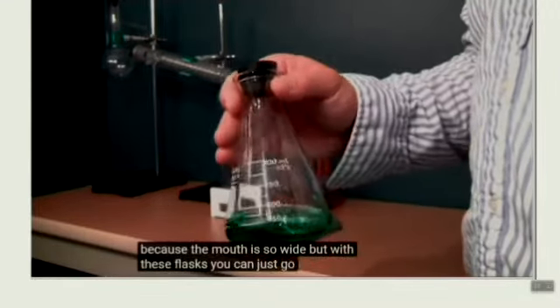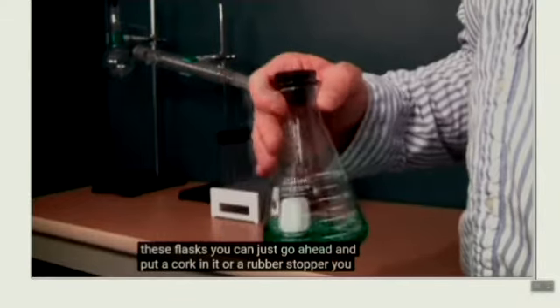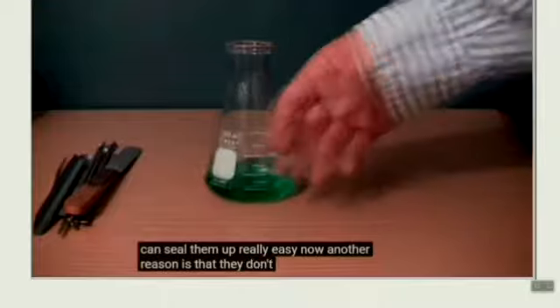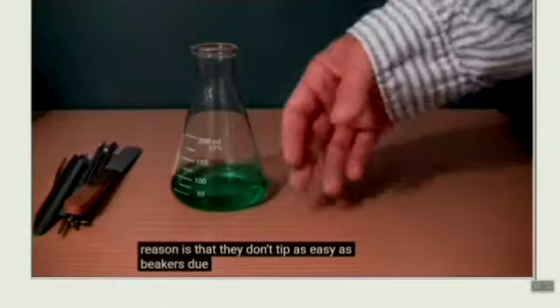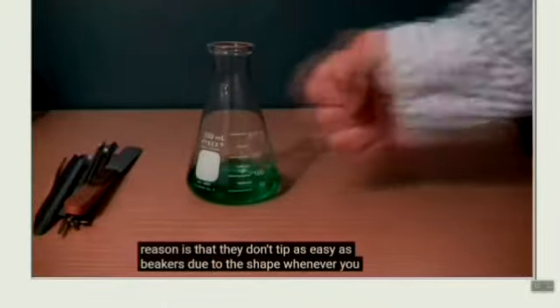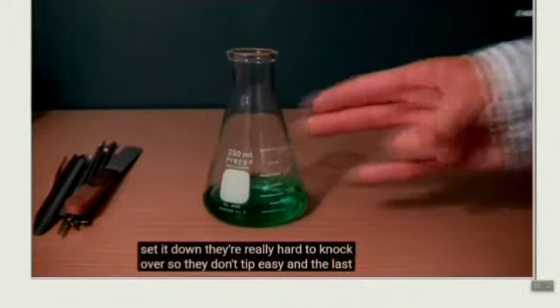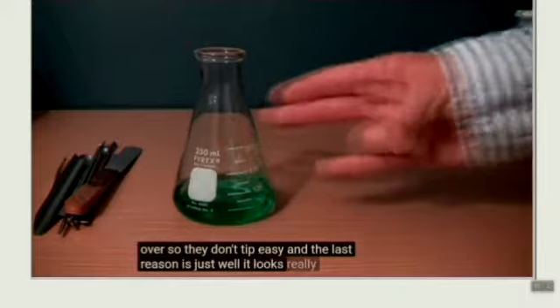But with these flasks, you can just put a cork or a rubber stopper in it. You can seal them up really easily. Another reason is that they don't tip as easily as beakers. Due to the shape, they're really hard to knock over. And the last reason is just, well, it looks really good.